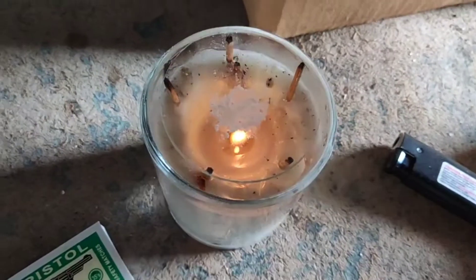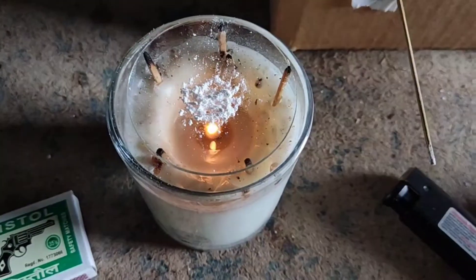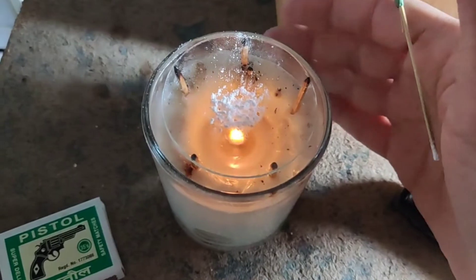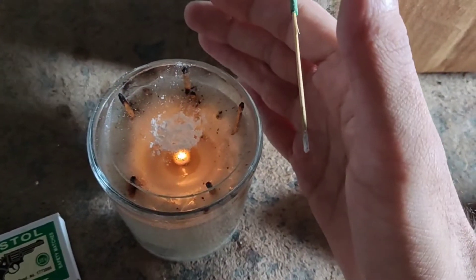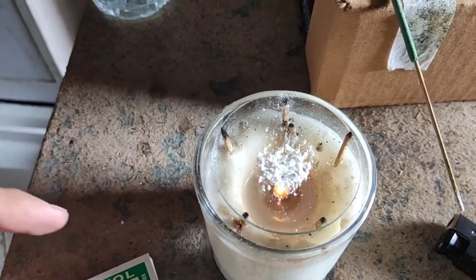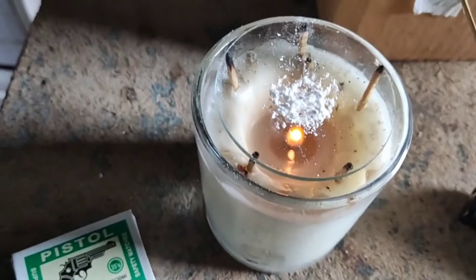Make sure you have a very pure form of powder before doing this process. I'm not doing it the recommended way right now — I'm heating it openly over a candle, so everything is going to vaporize. I have a watch glass, so there is the advantage that some vapor will condense on it and form crystals. I don't care much about product loss here, because I'm doing this method just to make a precursor crystal for the solvent method. In solvent recrystallization, you drop a crystal in and it provides a surface for other crystals to grow.